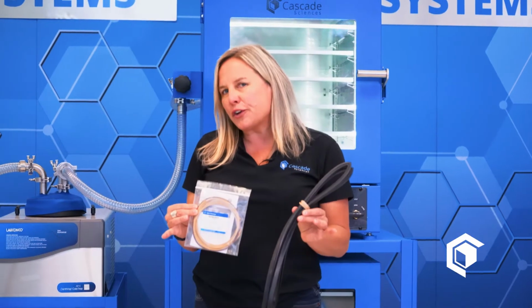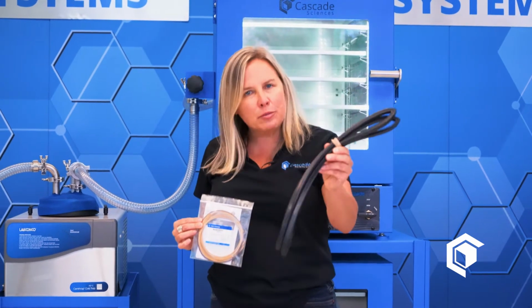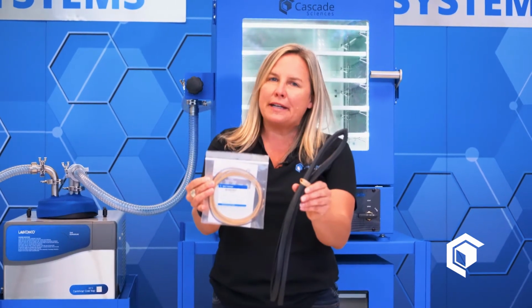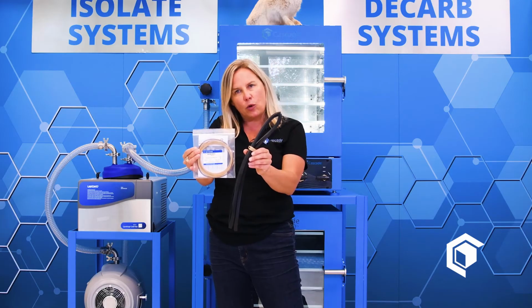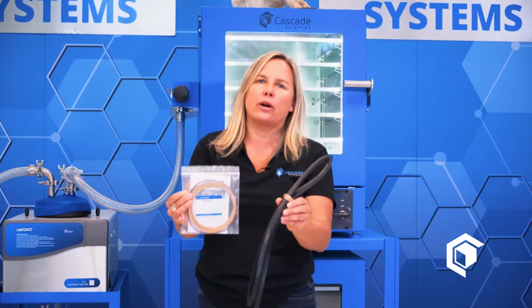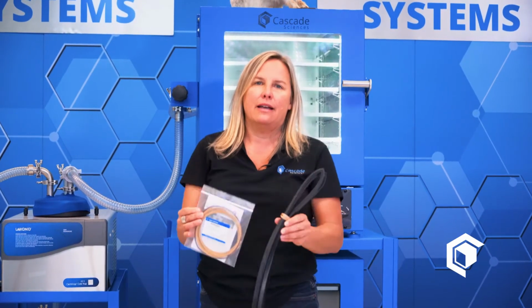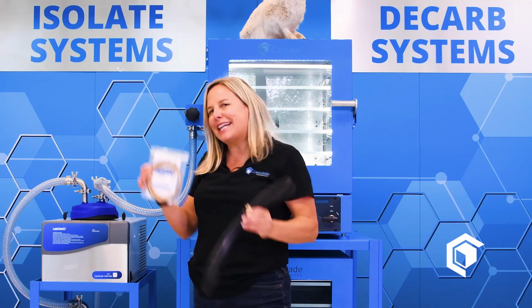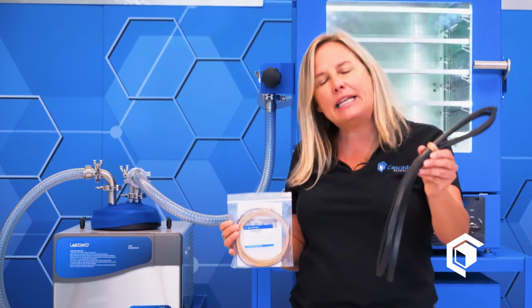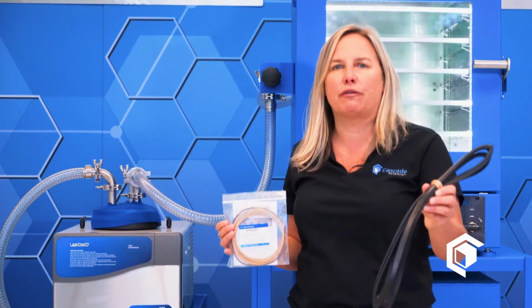The two things that are going to wear out on these packages are the vacuum oven door gasket and the vacuum pump tip seal. So we've put those two critical items in a single maintenance kit for you to have on hand so that you can keep right on processing. Again, expect the door gasket and the tip seal kit need to be replaced once a year under normal use. And we have a variety of different gasket materials as well for you to consider.